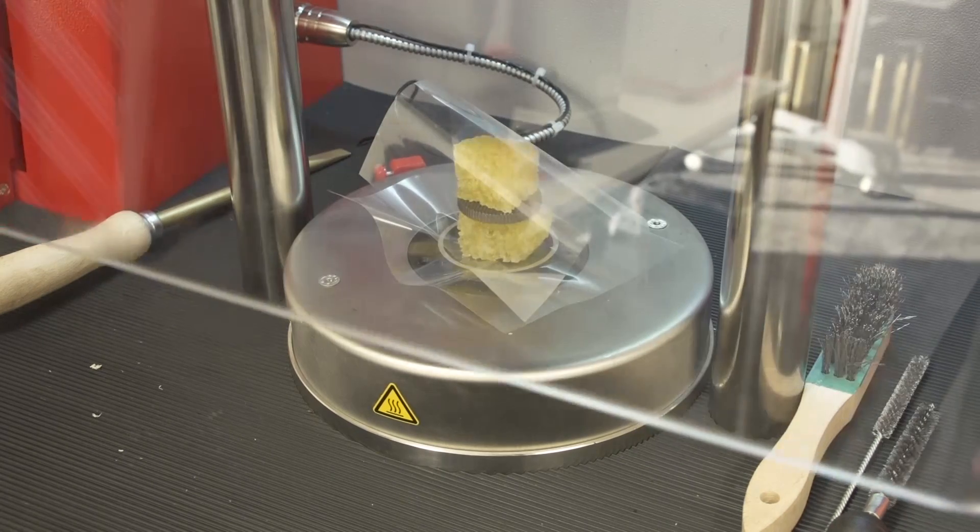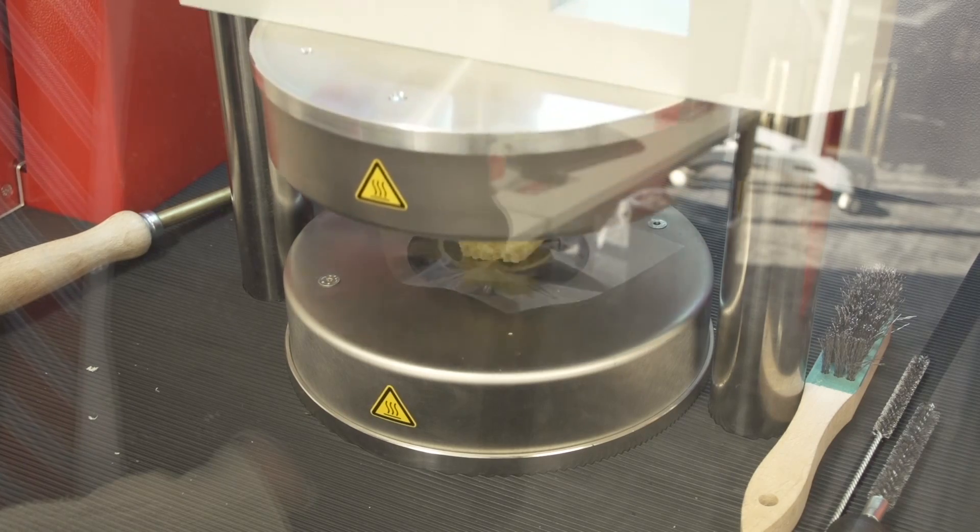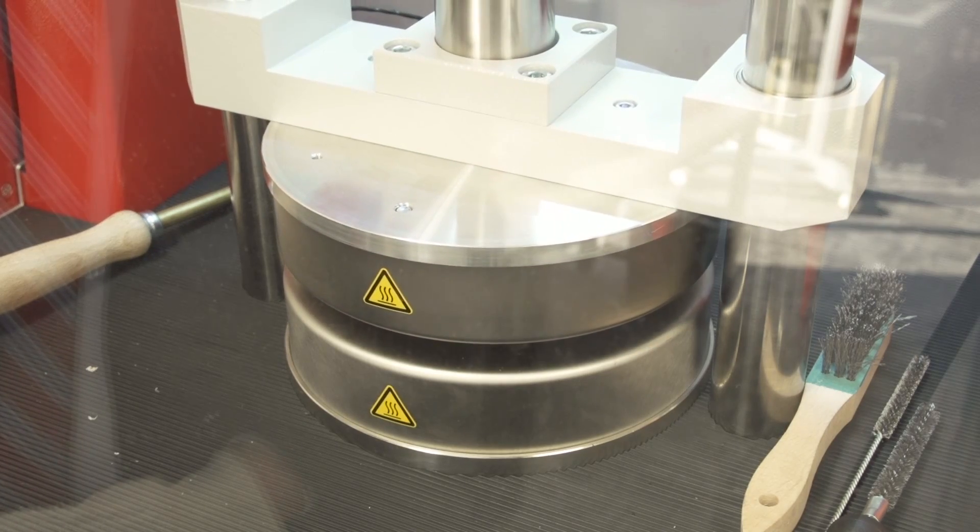This will close the safety shield as well as the main platens.